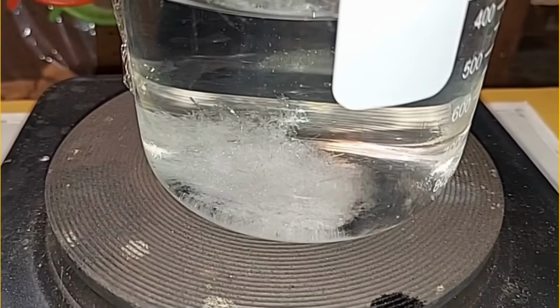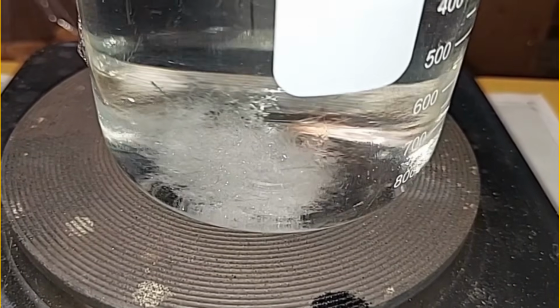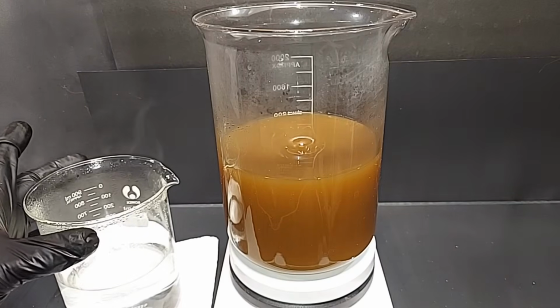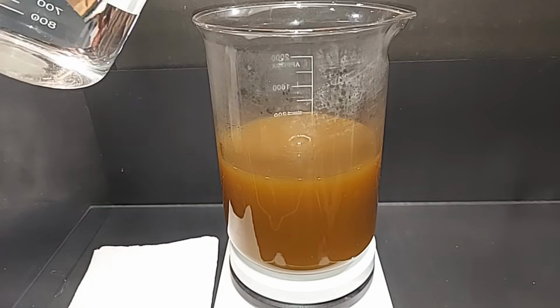Well, I didn't heat this quite enough. That's oxalic acid crystallization in there, which is now breaking down because I started to heat it again. But somewhere around 30 degrees or so Celsius, it did start to come out of solution. Just be aware. I have a nice warm oxalic acid solution here, and we're going to add this now to the ferrous sulfate. This will bring out the iron oxalate and the sulfuric acid.